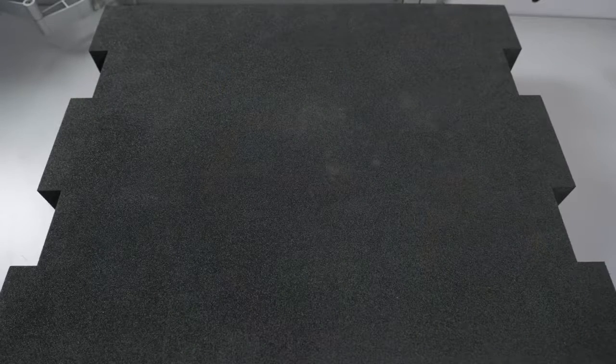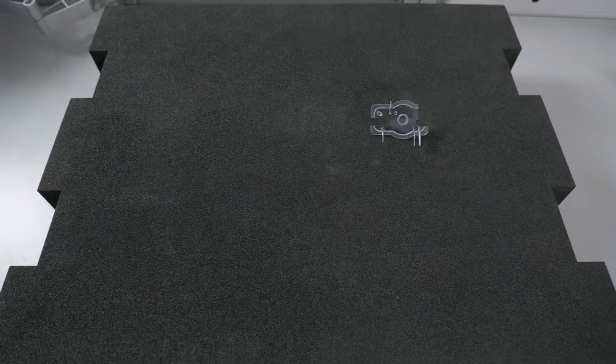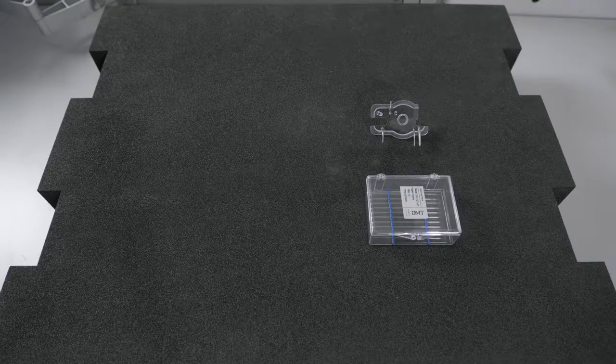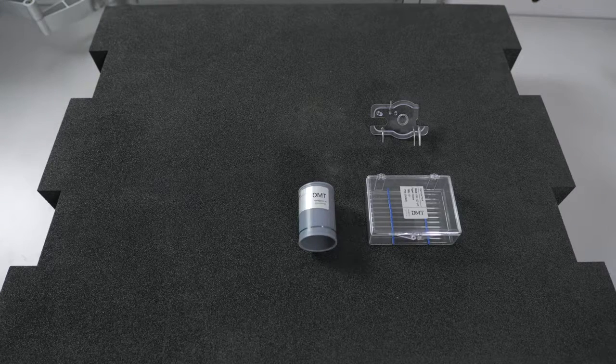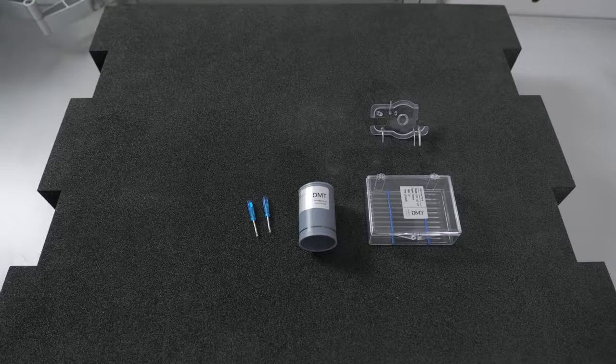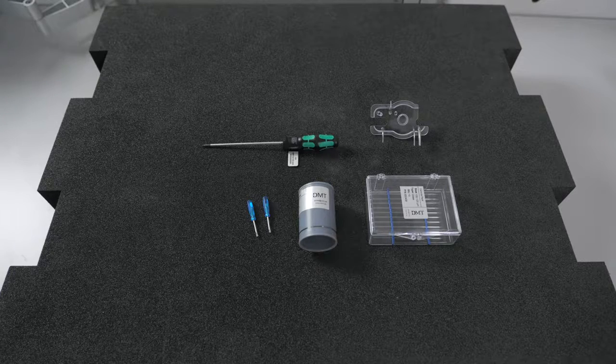The accessories that will be used with your chamber include a chamber cover, a pack of glass cannulas, nylon suture to secure your vessel, two screwdrivers, and a ball-end screwdriver for making adjustments.